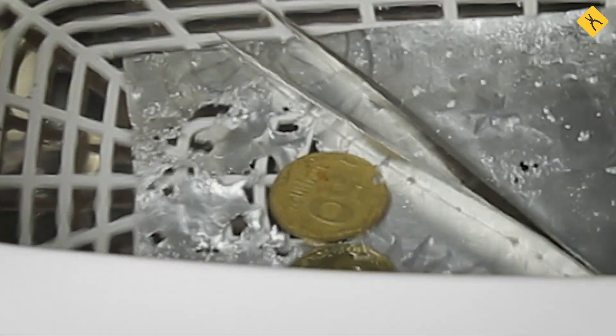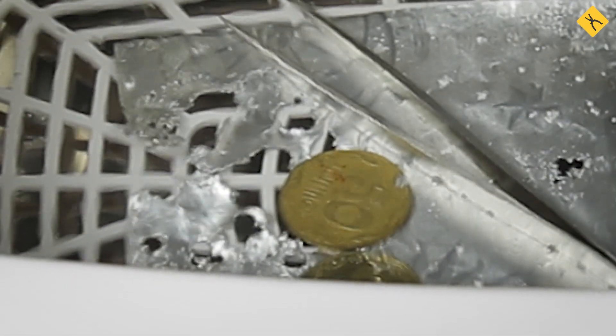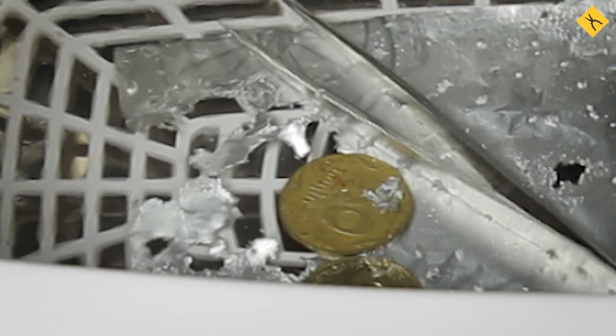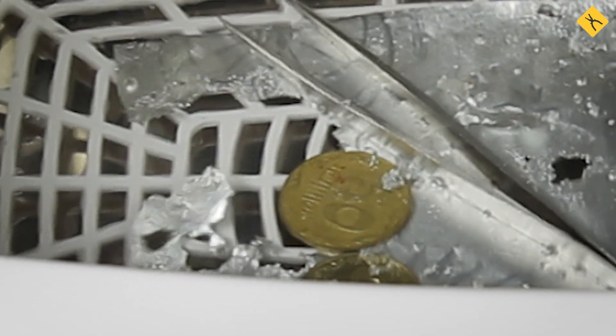Let's come back to our test. As you can see, the little holes in the piece of foil grow in size. The ultrasonic waves simply ruin the foil.